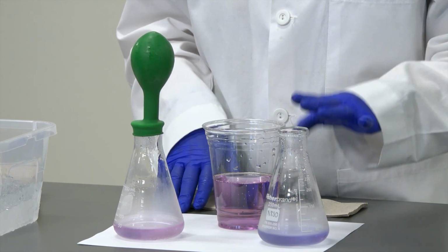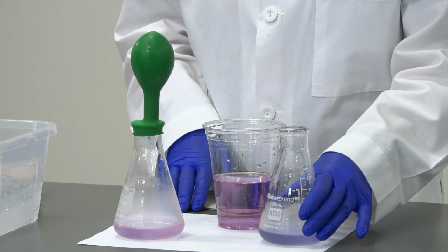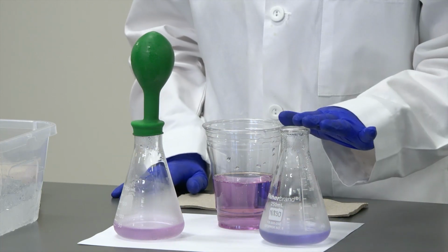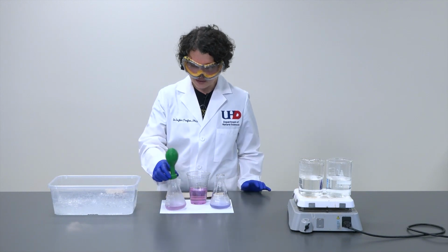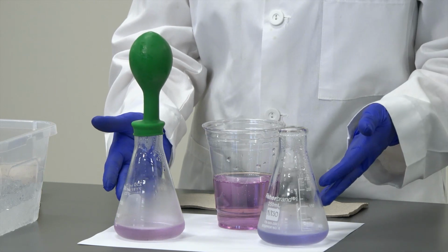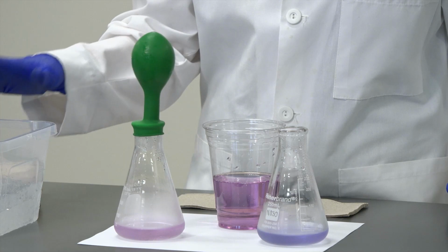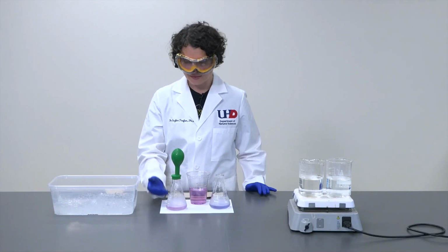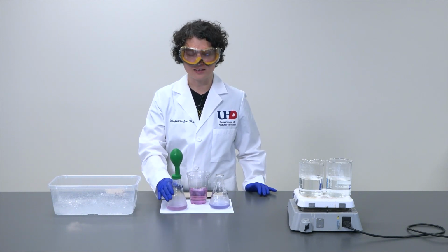When we heated it, and there was no way to recapture the carbon dioxide and cool it back into the solution, then it turned more bluish, and that color did not change despite us putting it back in the ice bath. When we attached the balloon to the Erlenmeyer, even though we heated it just like the other, the carbon dioxide was contained inside the balloon, and then when we cooled it down, the carbon dioxide from the balloon went back into the solution. The environment around it was more rich in carbon dioxide in the second case.